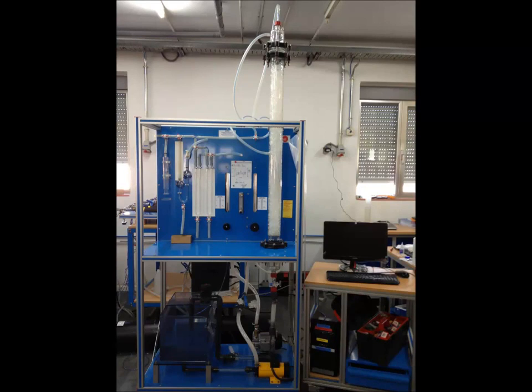In this video, I will demonstrate how to determine the CO2 content in an airflow using the CAGC unit.